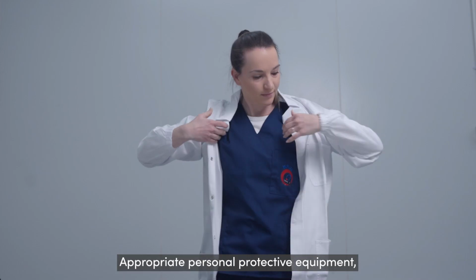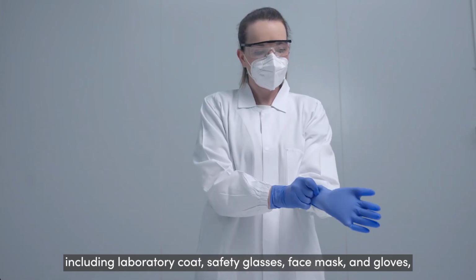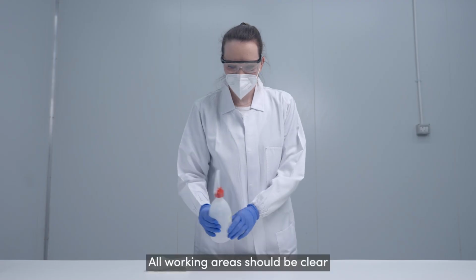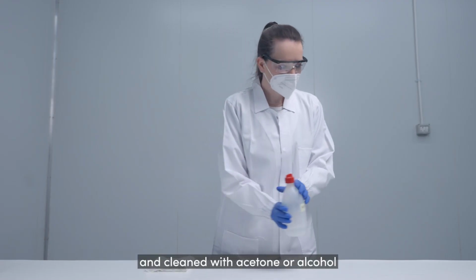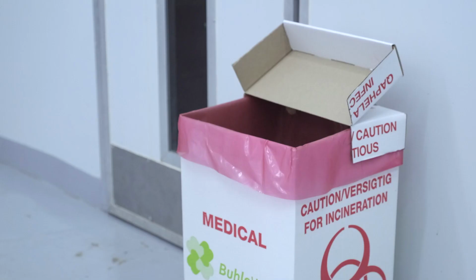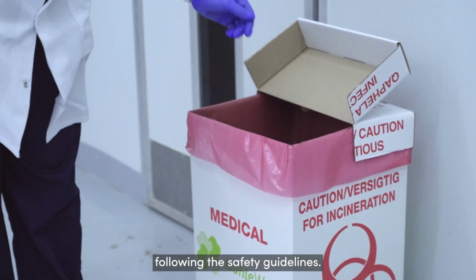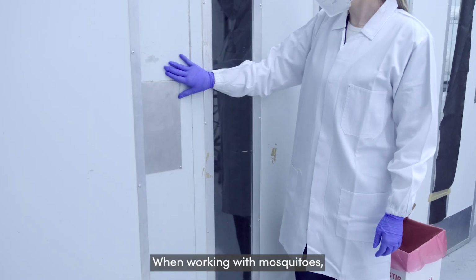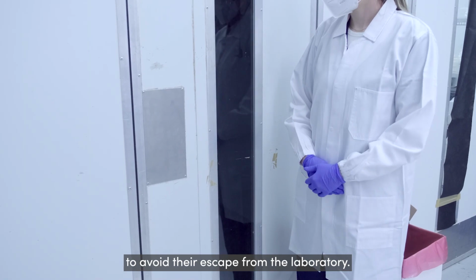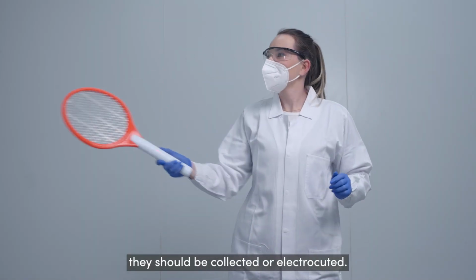Appropriate personal protective equipment, including laboratory coat, safety glasses, face mask, and gloves, must be worn at all times when handling insecticides. All working areas should be clear and cleaned with acetone or alcohol before performing the test. Make sure you dispose of all waste materials appropriately following the safety guidelines. When working with mosquitoes, keep all doors and windows shut to avoid their escape from the laboratory. If any mosquitoes do escape, they should be collected or electrocuted.